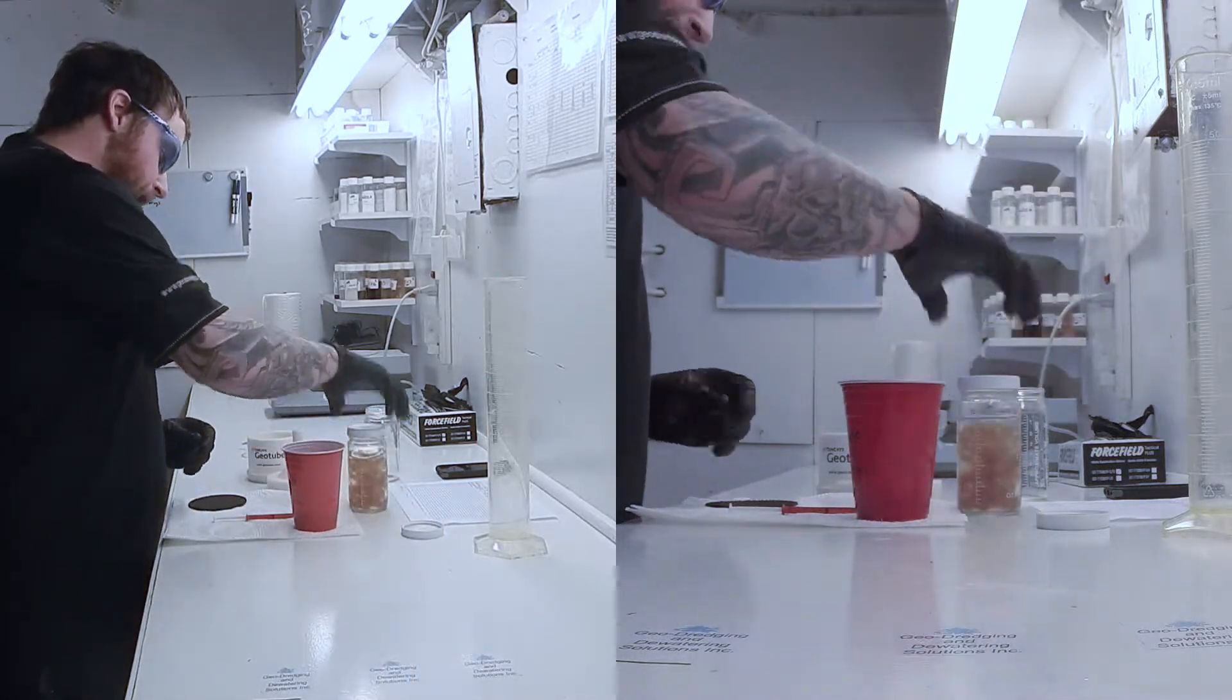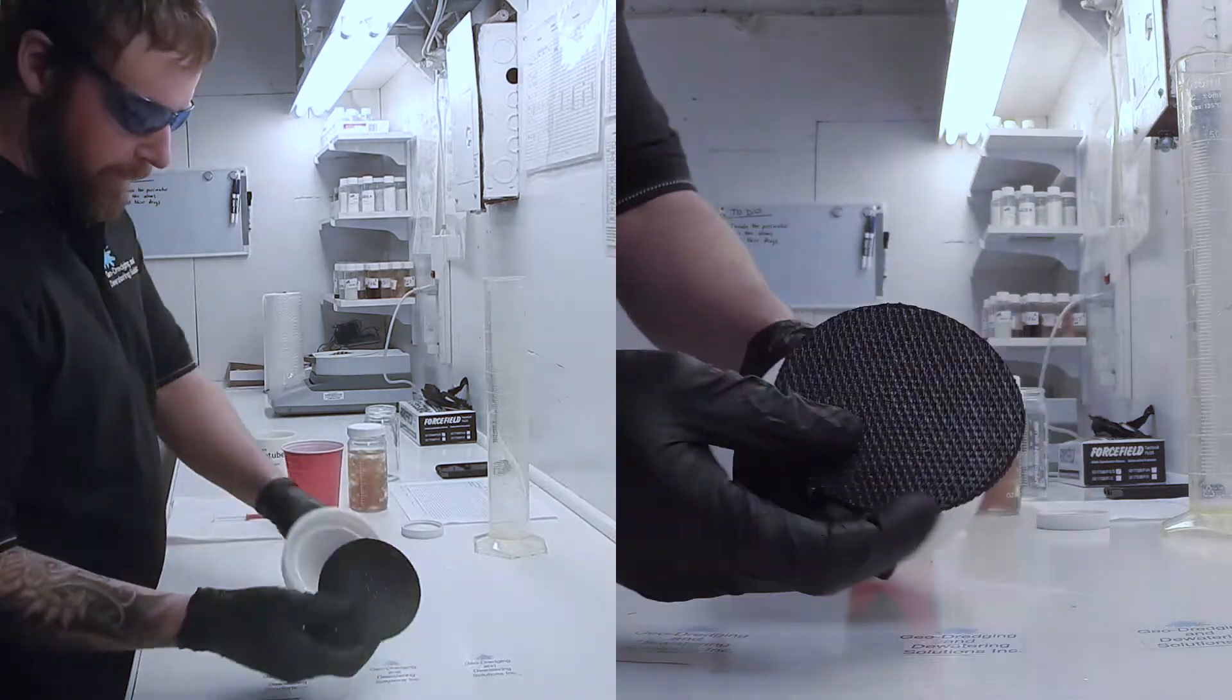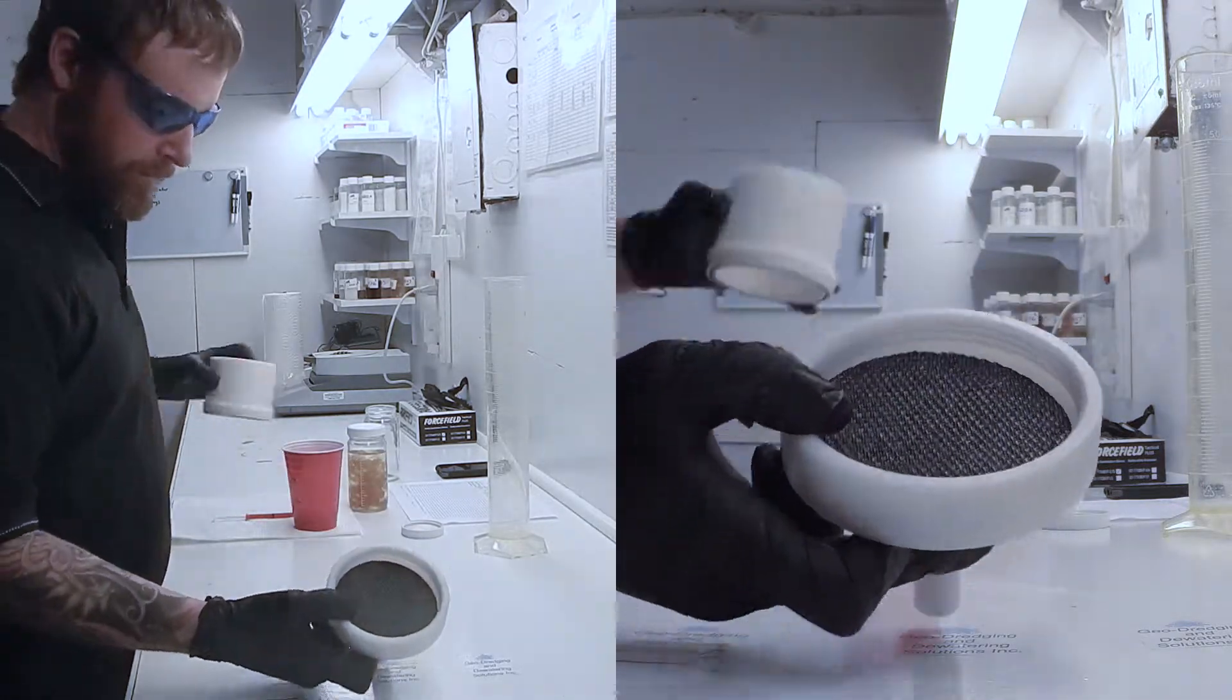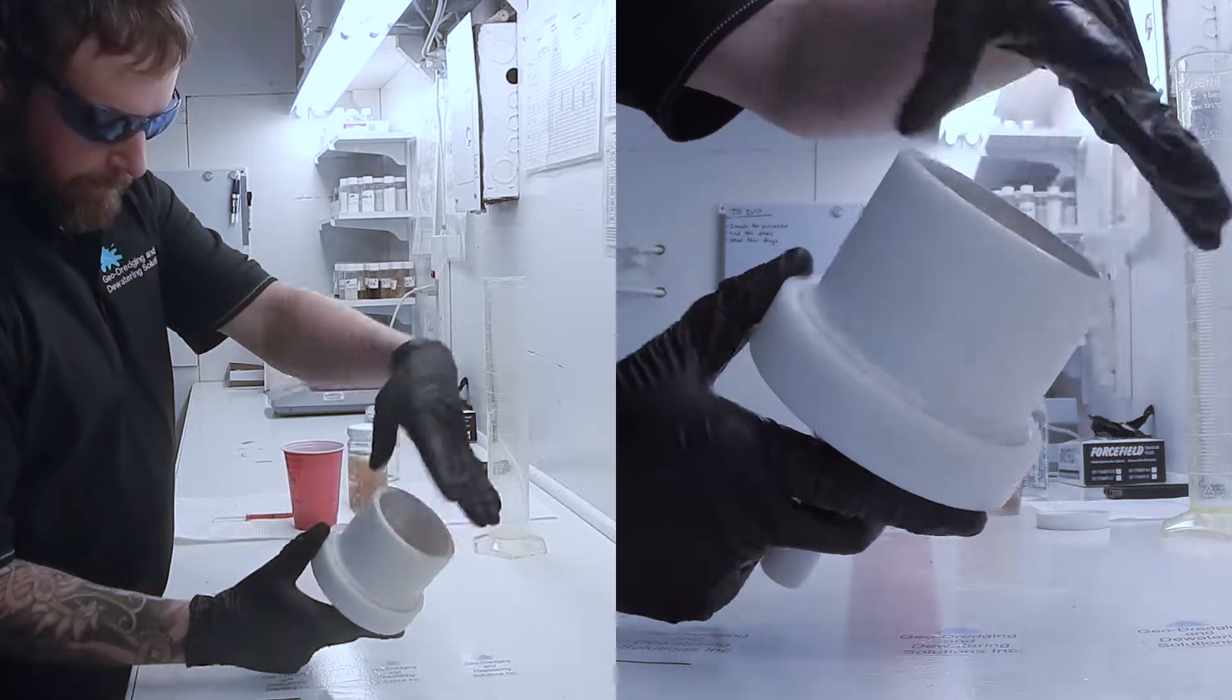In order to do that, we have to assemble our RDT. We take the disc and insert it into the funnel and simply screw on a cylinder.